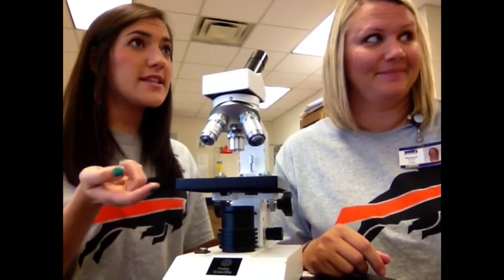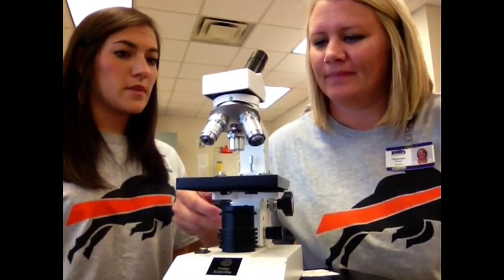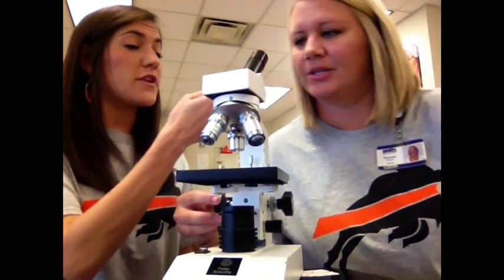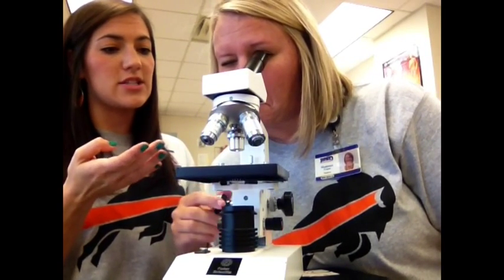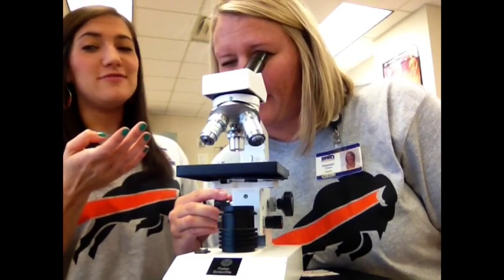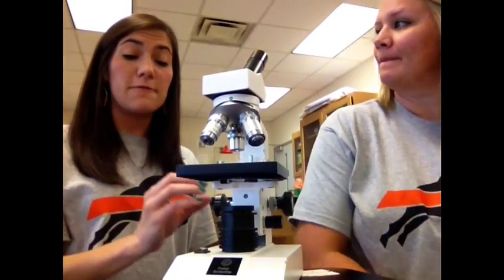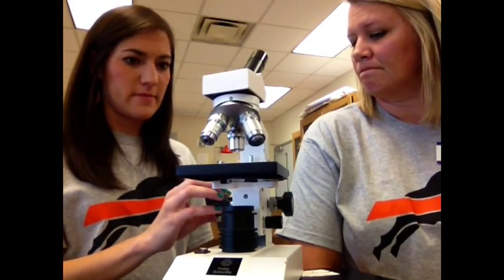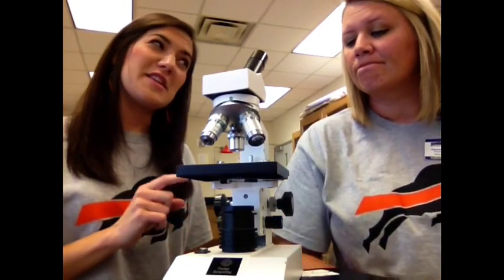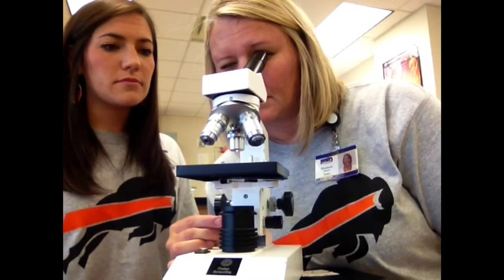All right. The next thing you'll do is move your stage all the way up, or bring it into focus. So Coach Fears is going to look into the eyepiece, and she's going to bring it up until she thinks it is just about in focus. Oh, yep. Looks like she found it. So the next step is to begin to focus using the coarse adjustment knob first. And if you remember, that's the big knob. So once Coach Fears has got it in place, she's going to use the fine adjustment knob, the small one, to make it as clear as possible for her to look at.